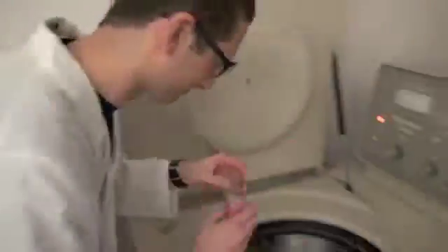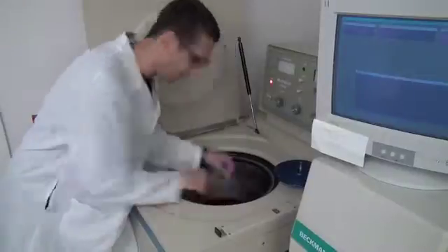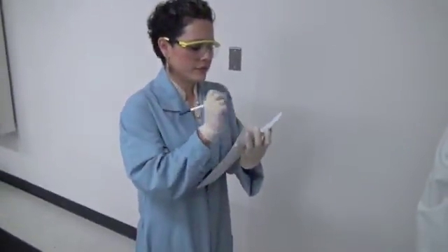When multiple researchers are spinning their samples in the centrifuge, it's important to know which slots your samples are in so the Master TA can easily distribute them out later. Slots 2 and 14. Got it. And I like how she writes it down.